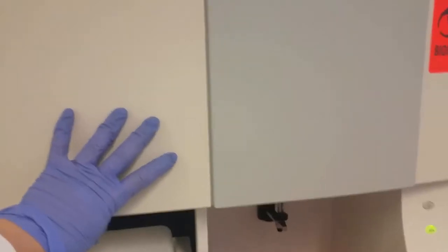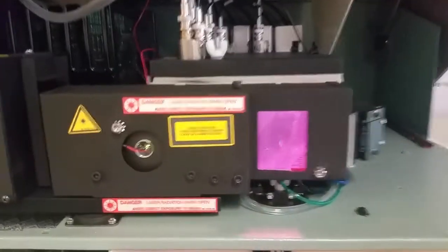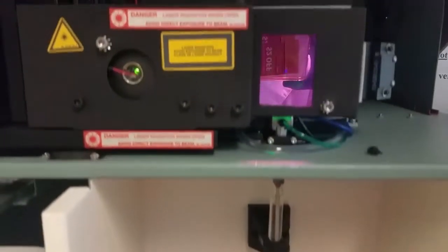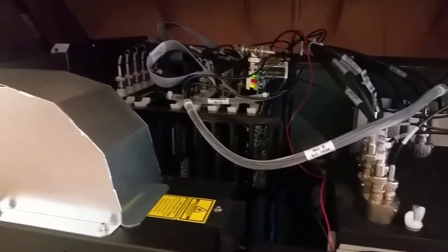Here's the flow cytometer. There's a cover on the flow cytometer that you can open. Inside the flow cytometer, there's a laser, and that laser is going to interrogate the cells. The sample of cells is put on the sample uptake port, and then the cells will flow by the laser. There are a variety of detectors and filters in the machine that are going to gather all of the information revealed from the laser passing through or hitting the cells.